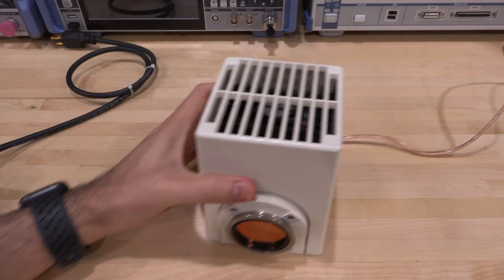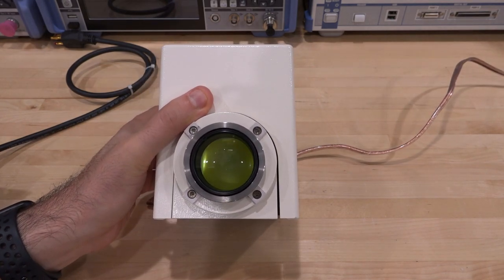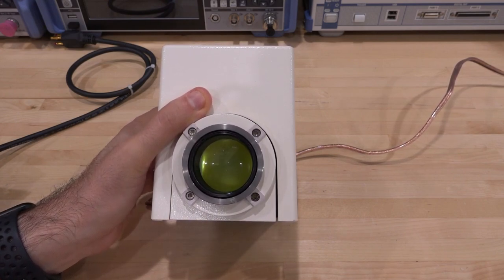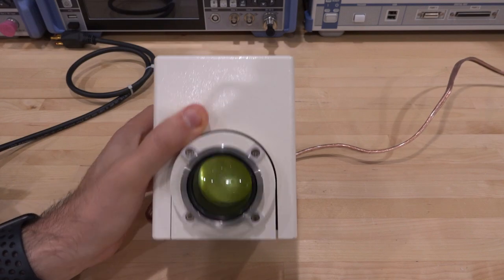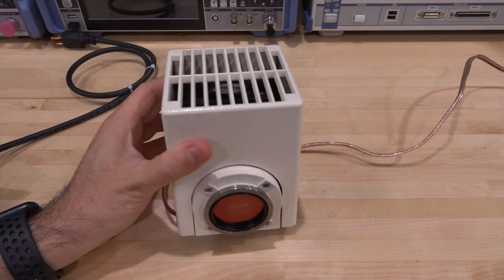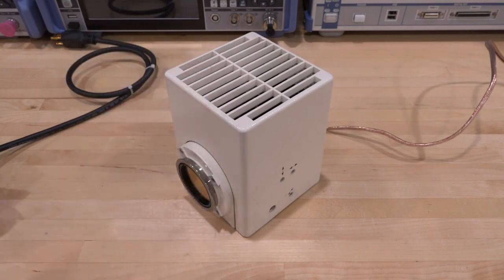So I built this originally, and this has an LED array on the inside of it, you can see. But this was the wrong approach, because this is a very large aperture light, and therefore it wouldn't really do what we want. We can't fix that, as I said, with optics. So even though it works, almost all the light this generates is wasted. Only the very few elements in the middle actually contribute to illuminating the sample. So we have to find a different approach.